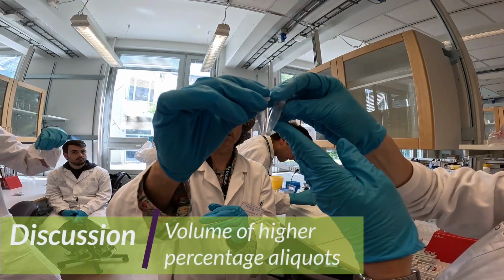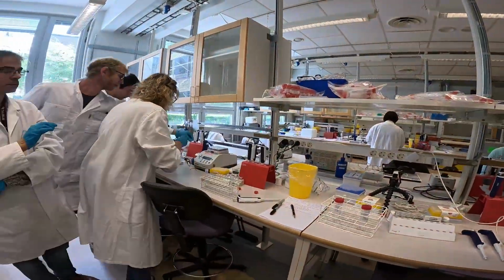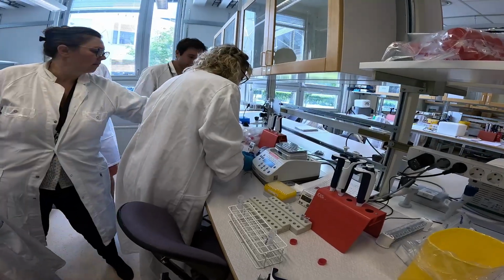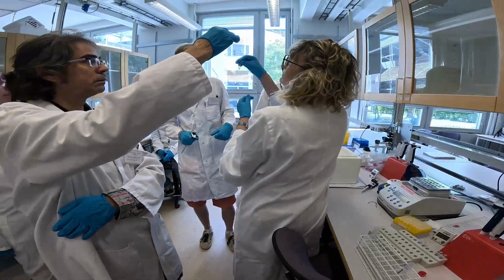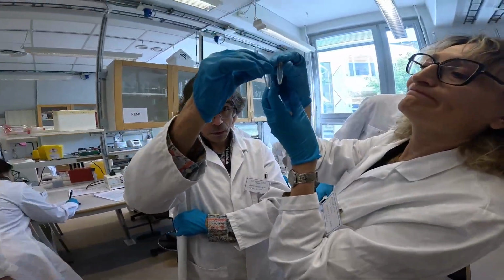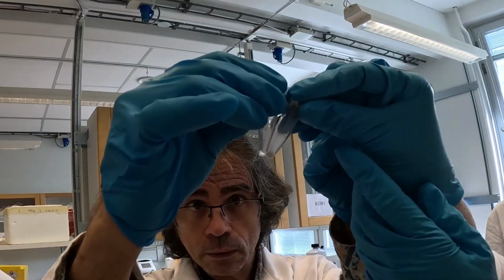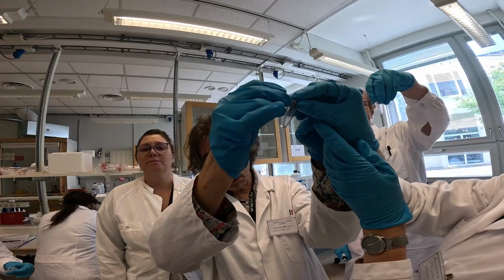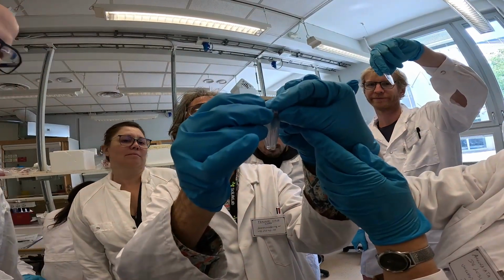Thank you. So I think do a quick spin of the pellet in the microcentrifuge. Okay, good. Now, compare it. This one is close enough. It's very close, isn't it? What about the 40? I think so. Maybe there's a slight difference but more or less. So the 40 is also not that big.